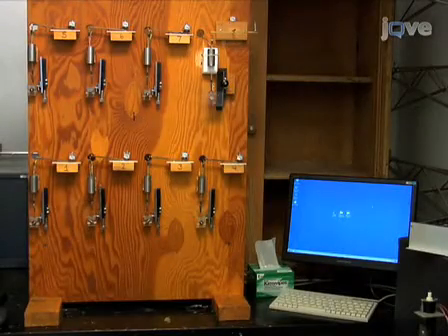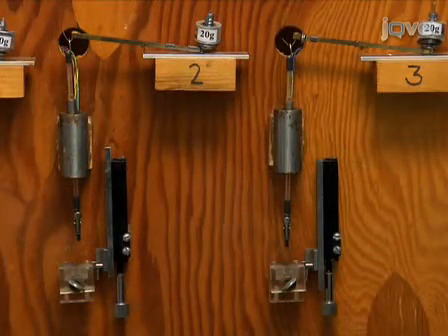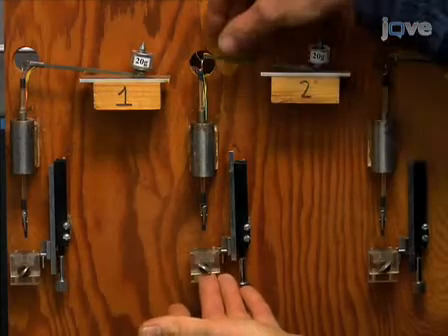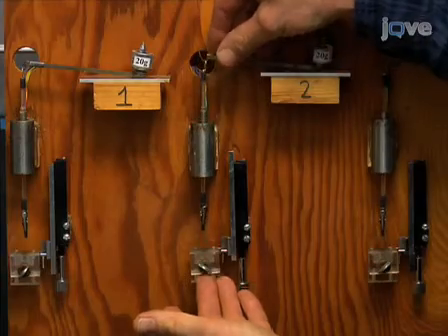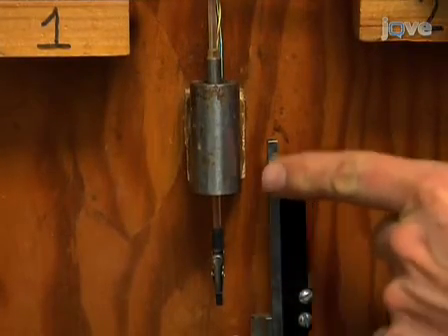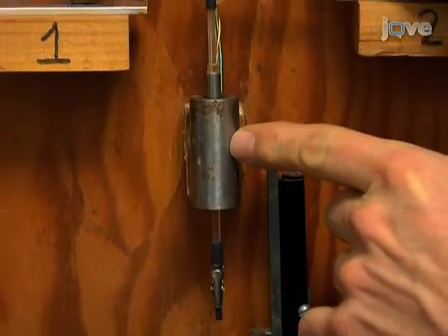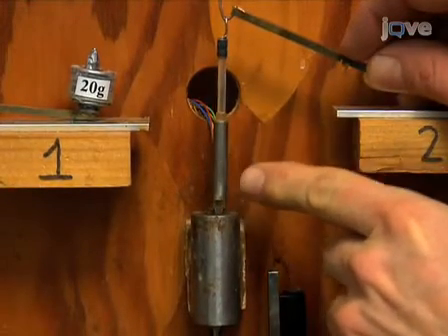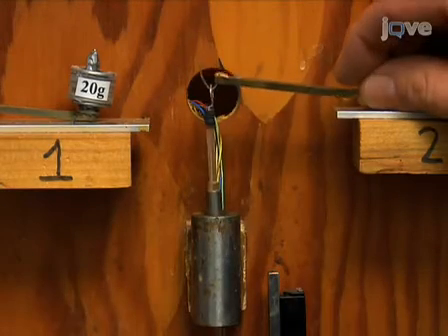The wall samples are now clamped in a constant force extensometer. This is a custom-built device that consists of a plexiglass cuvette for holding the basal end of the wall sample and a movable clamp attached to the apical end of the sample. The movable clamp is mounted on the end of a rod that passes through the open coils of a position sensor, an LVDT or linear variable differential transformer, that electronically detects the position of a small metal cylinder or core that is attached to the rod.